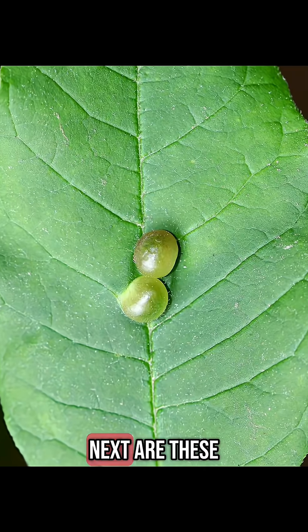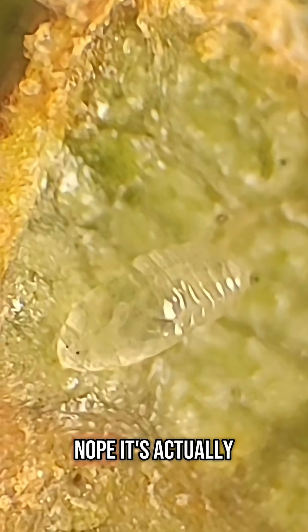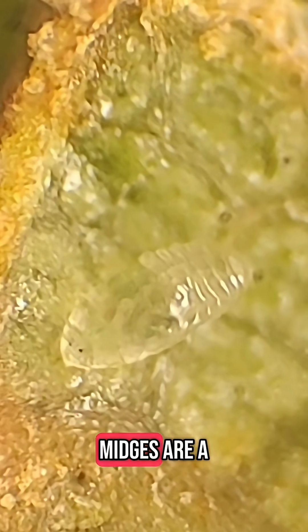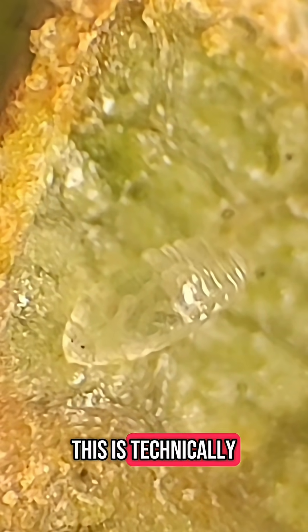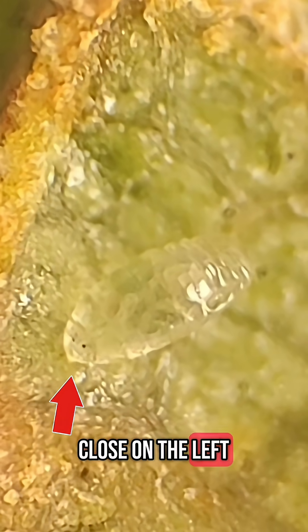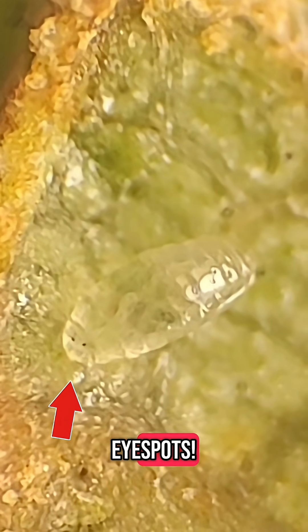Next are these ash leaf galls. What is that, a worm? Nope, it's actually a midge larva. Midges are a type of fly, so I guess this is technically a maggot. If you look close on the left, you can even see two little eye spots.